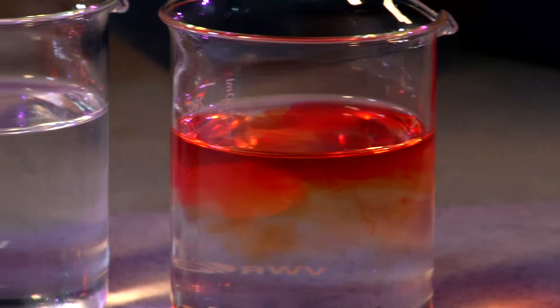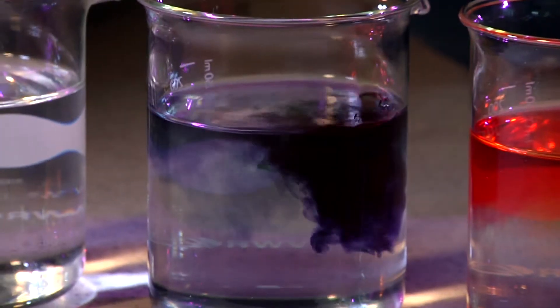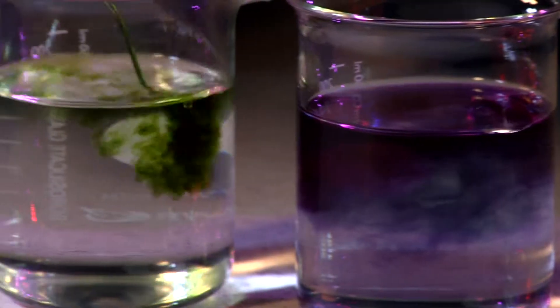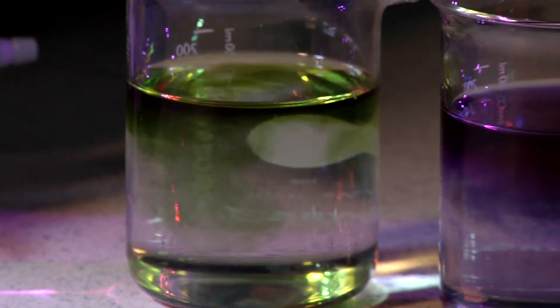Red for acid, purple for alkali, and green for neutral.